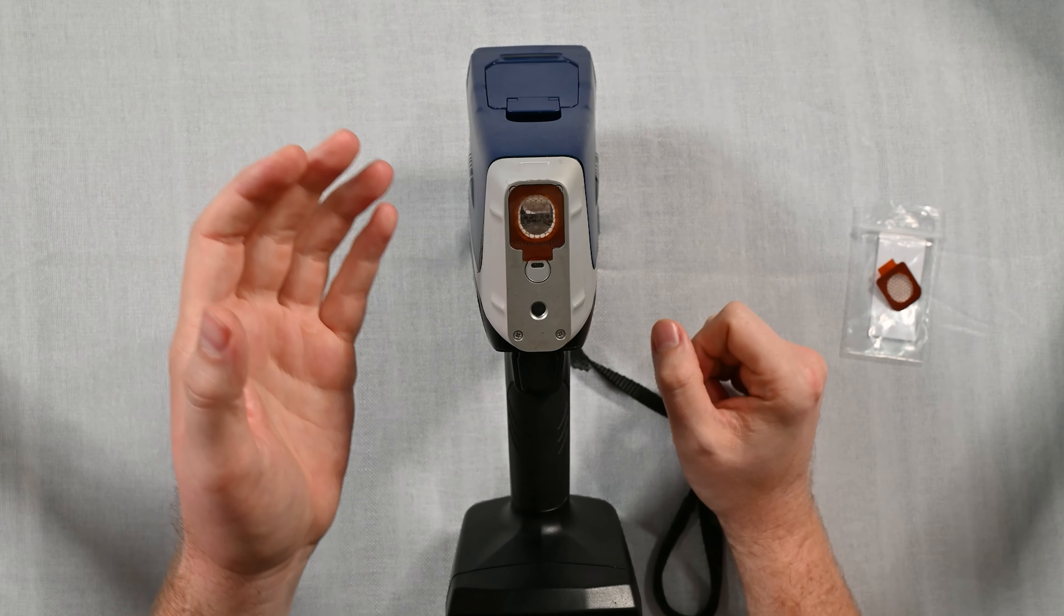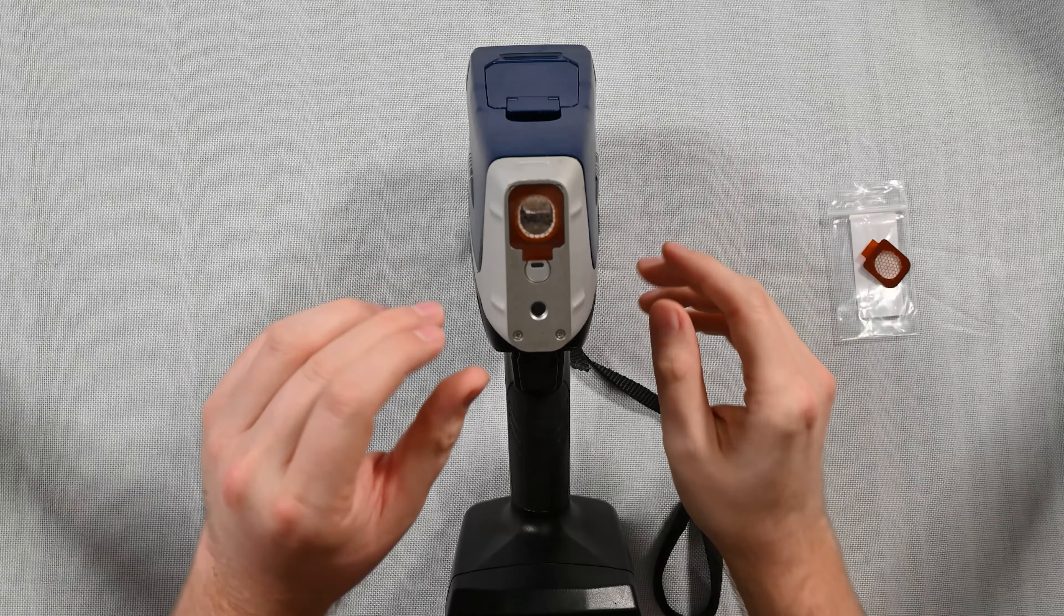In your case you're going to find more windows just like this one. I've set that aside here. We're pretty much ready to go.